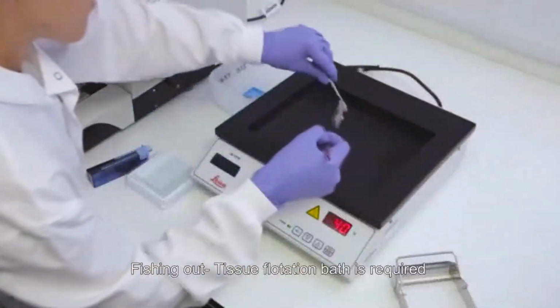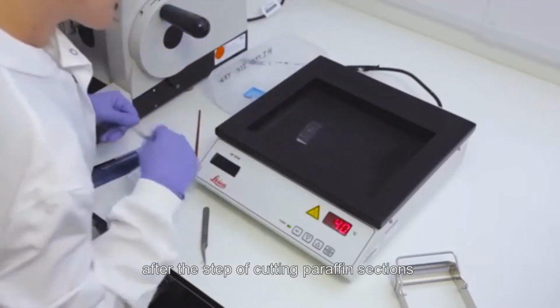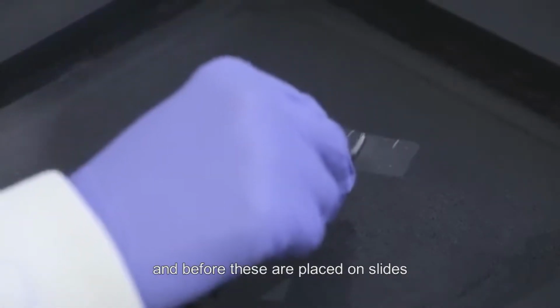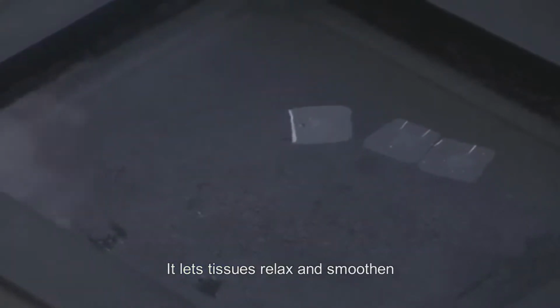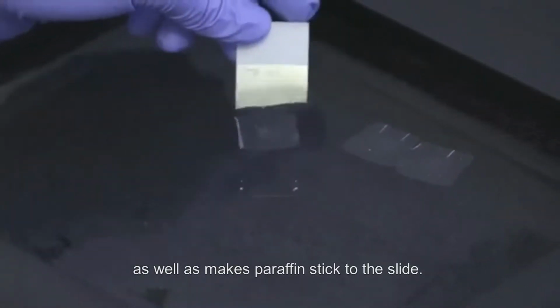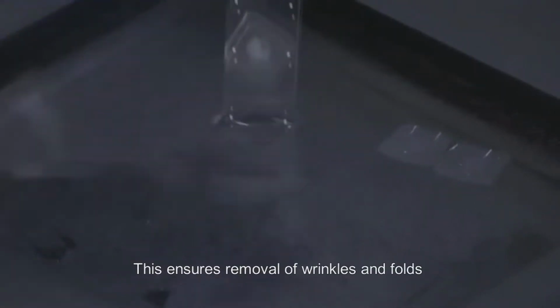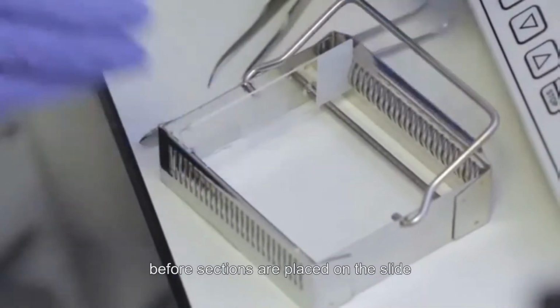Fishing out. Tissue flotation bath is required after the step of cutting paraffin sections and before these are placed on slides. It lets tissues relax and smoothen before being mounted on a slide, as well as makes paraffin stick to the slide. This ensures removal of wrinkles and folds before sections are placed on the slide.